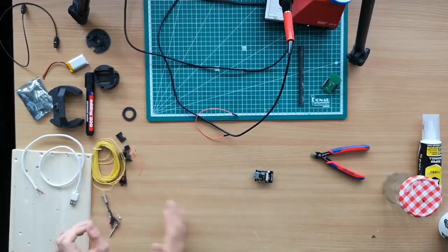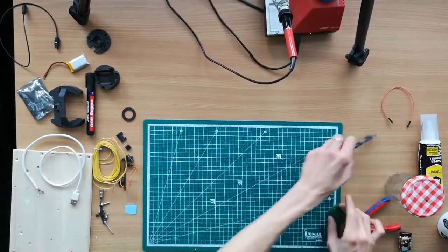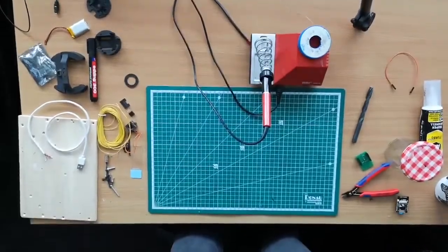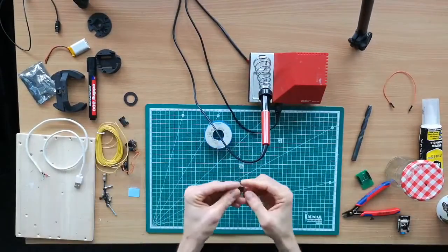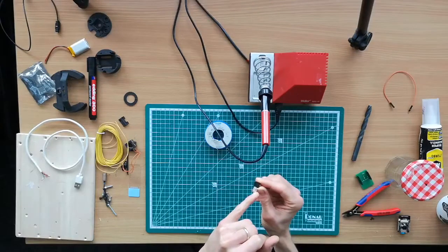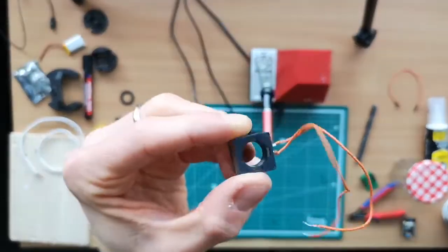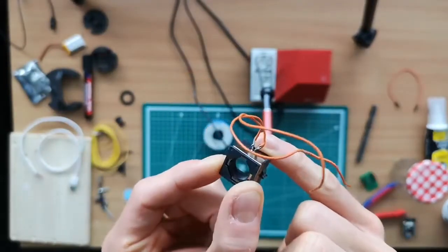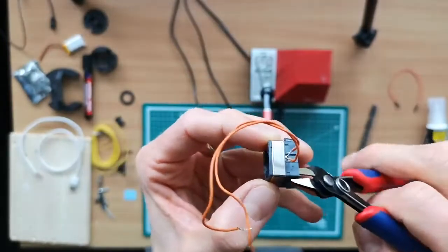So we just move everything aside. We have this piece here for soldering so that the table stays nice. And we are just going to do that now. So this is a PNP transistor. The order is BCE, so base, collector, emitter. And we already have the lens here, which is an M12 focusing lens from a CCTV lens. And we already wired up the two connections here. I always confuse plus and minus, so we have to find that out. Eventually we have to change the order.